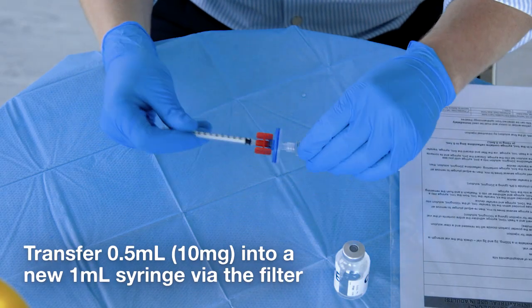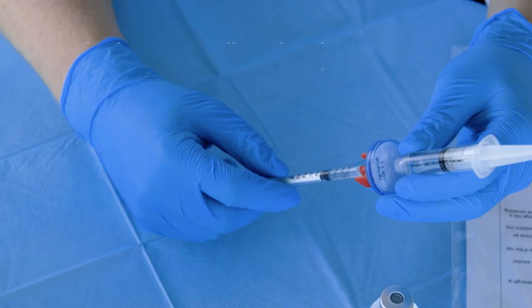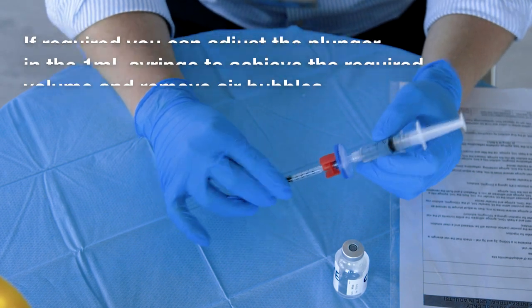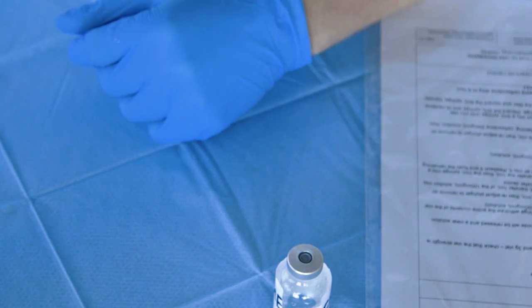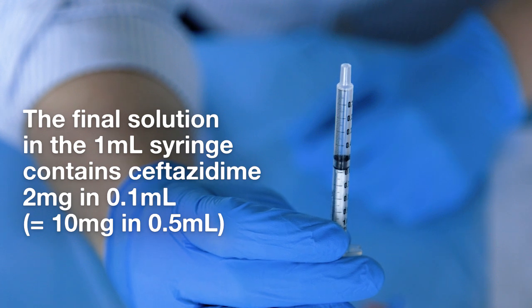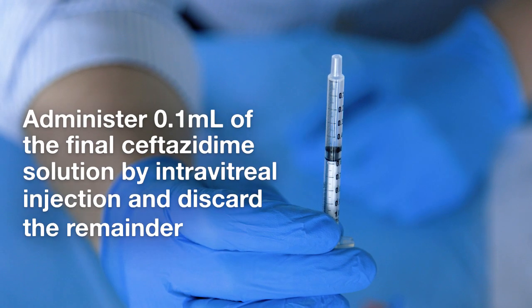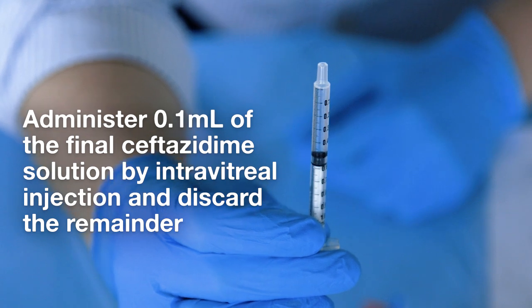Transfer 0.5 ml, 10 mg, into a new 1 ml syringe via the filter. If required, you can adjust the plunger in the 1 ml syringe to achieve the required volume and remove air bubbles. Discard the 5 ml syringe, transfer device, and filter device. The final solution in the 1 ml syringe contains ceftazidime 2 mg in 0.1 ml, which is equal to 10 mg in 0.5 ml. Administer 0.1 ml of the final ceftazidime solution by intravitreal injection and discard the remainder.